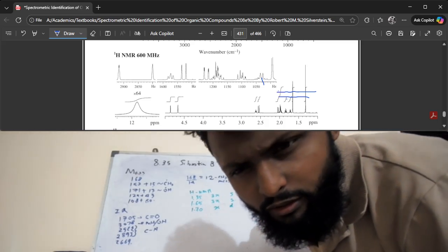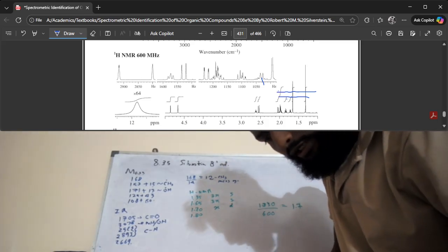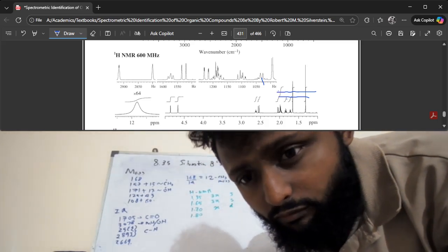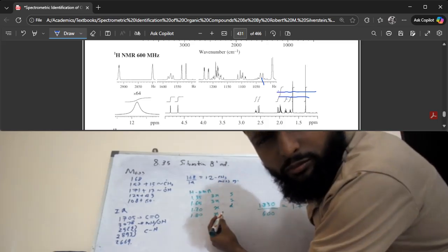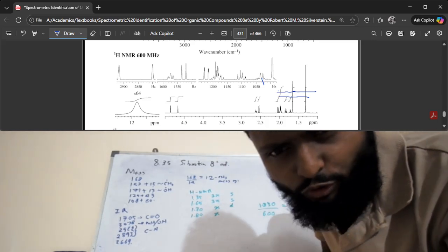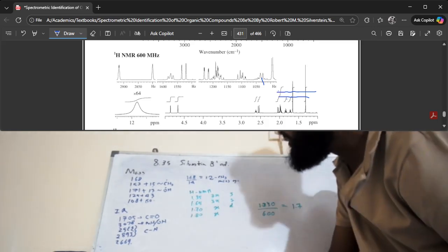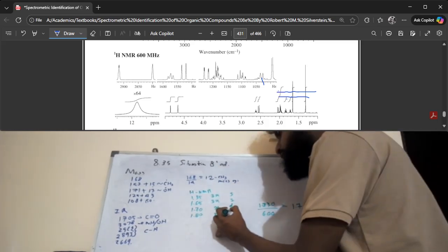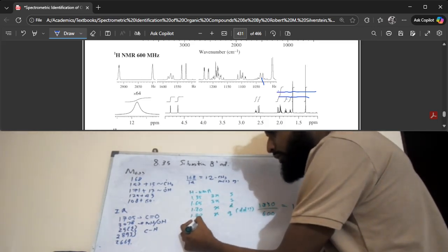So then we have another one at 1.8. It's also important to notice that the peak at 1.7 is x height, and 1.8 is also only 1x. It's 1/3 of the tallest peak. Whereas it looks like a doublet of a doublet. You can also call it maybe a quartet, but we can't be too sure. It's not very symmetrical or neat to look at. It looks like a quartet, so we just say it's a quartet, or maybe it's a doublet of doublets. I don't know that at this point in time.